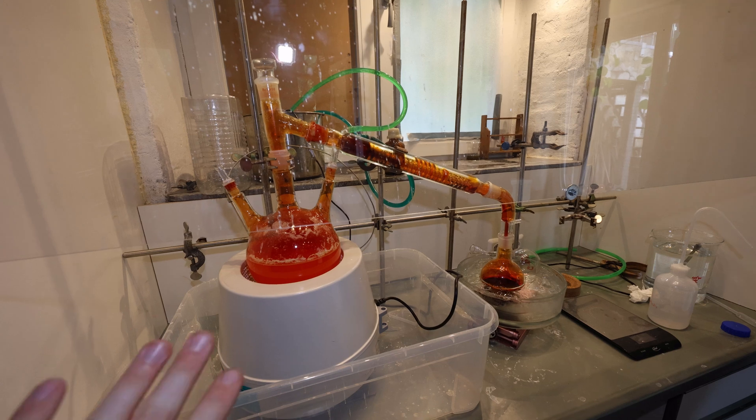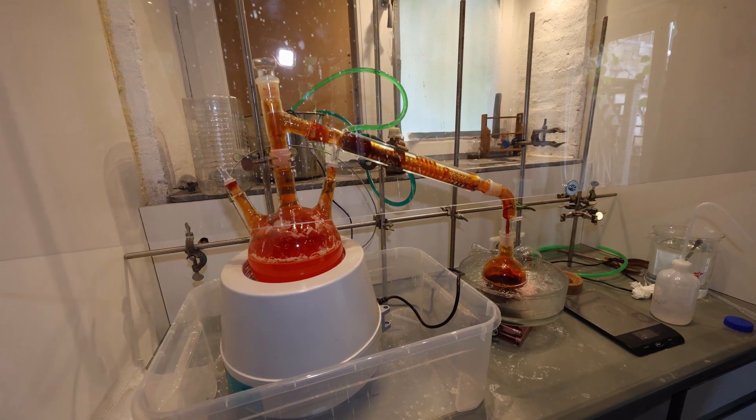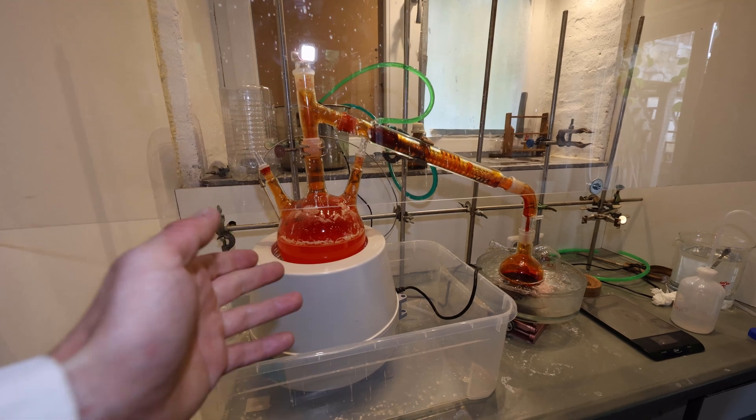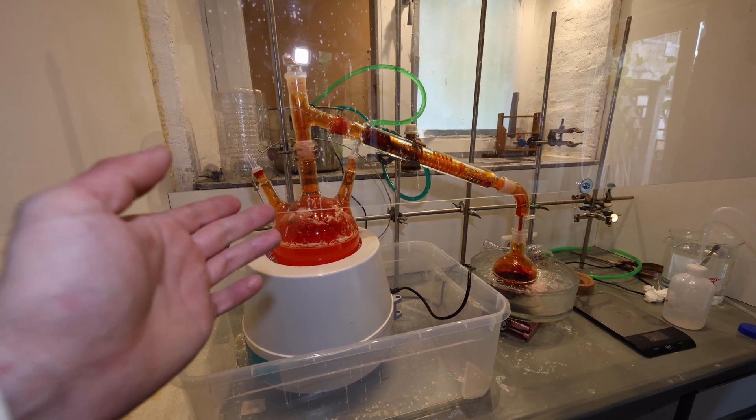So there's now less bromine coming over and it actually bumped a lot so we stopped the distillation and now we're going to take it apart.